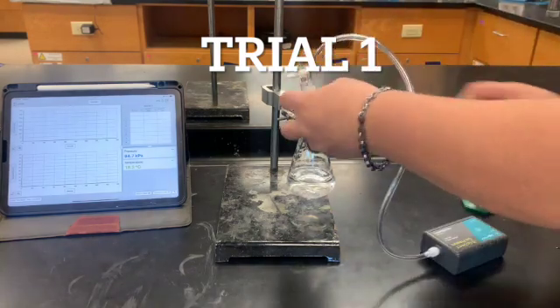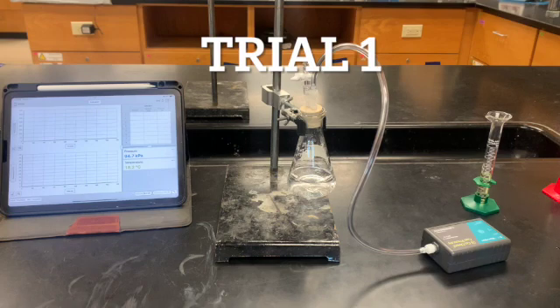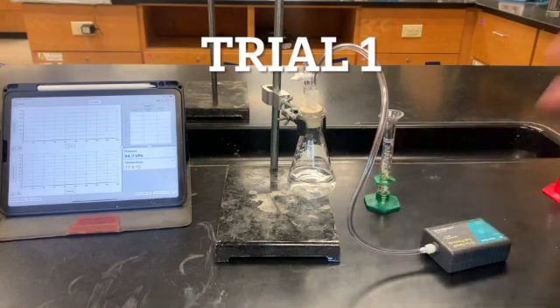Okay. All right. So I've got that in there. Now, if we're lucky enough to have syringes, then you'll use a syringe to put in there. If not, we're simply going to take what we have and pour it in there.